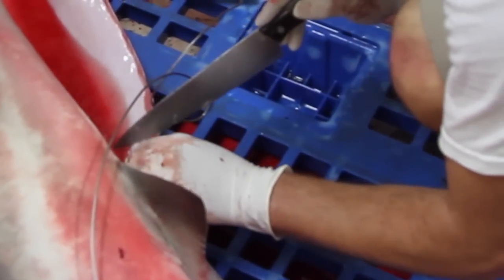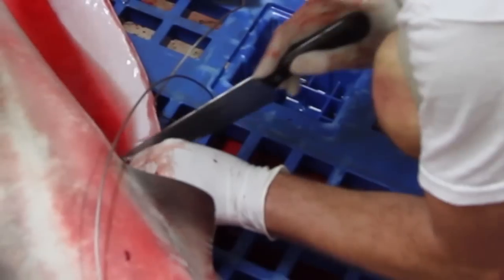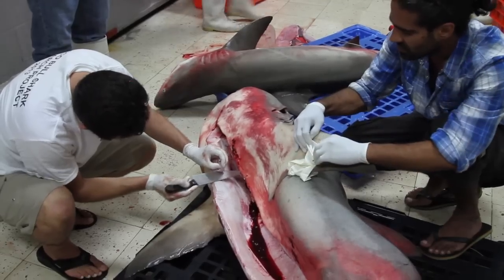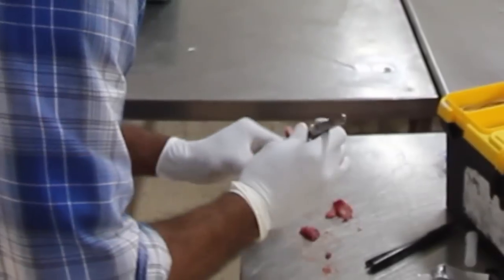We are going to take a muscle biopsy for genetics analysis and stable isotope research.